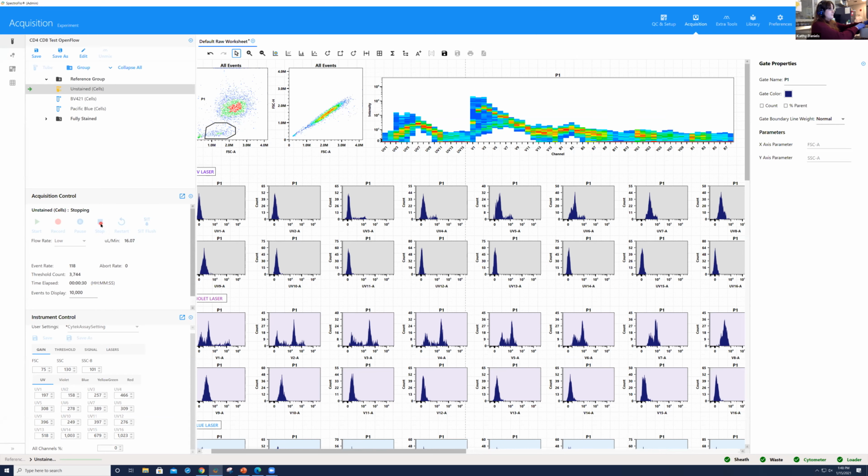So I'm going to hit stop, and I'm at the point now because I've adjusted my scatter settings, my fluorescence is all okay, and my threshold is good. I'm going to go ahead and record all of my reference group samples. So I'm putting my unstained back on. I'm going to change the flow rate to go a little bit higher, okay? I'm going to go ahead and select start.